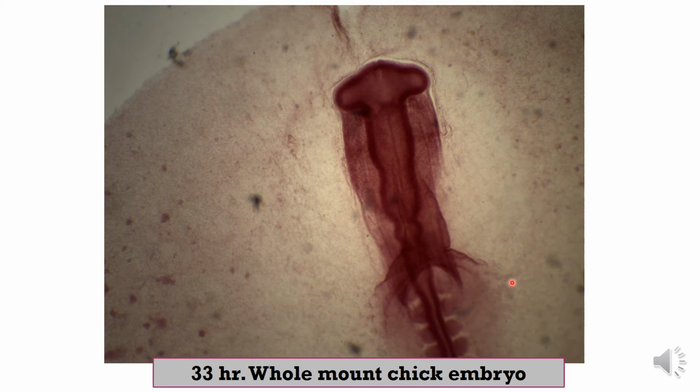Next slide, this slide is 33 hours, also a whole mount of the chick embryo. In this slide you can see more development, when the two limbs of the heart tube fuse forming a single heart tube.